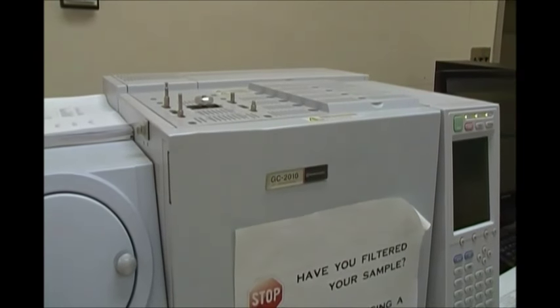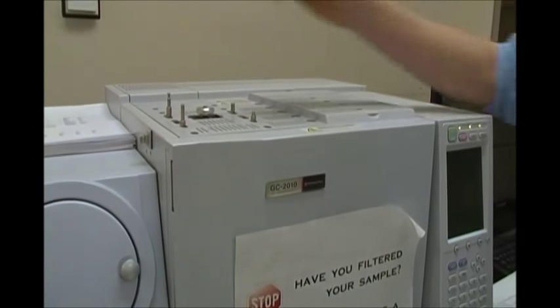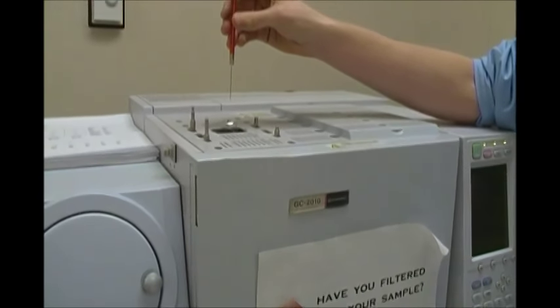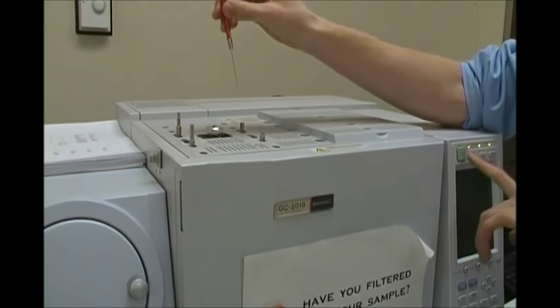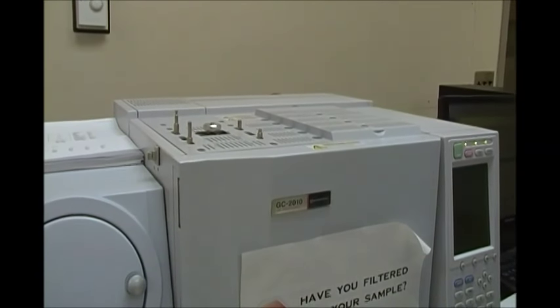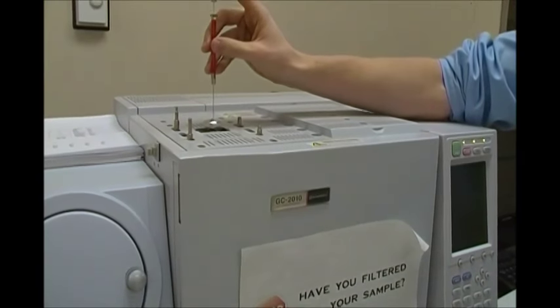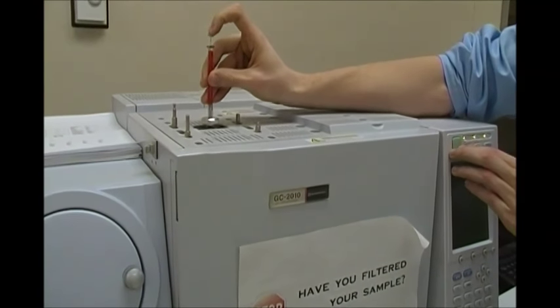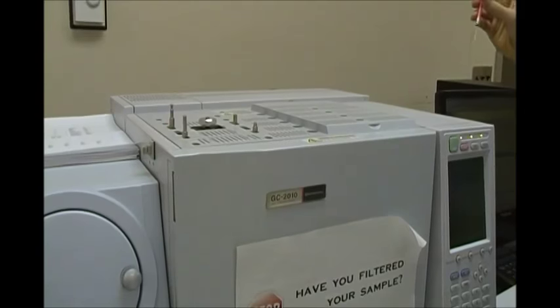And so the way we're going to do this is we're just going to put our sample into our port. We're going to insert it and at the same time inject and hit the start button. So here we go. Just like that.